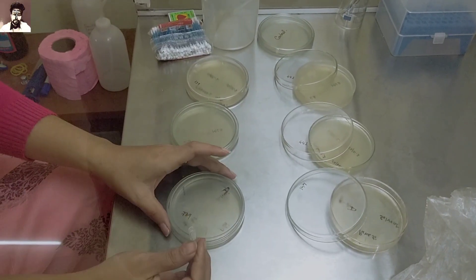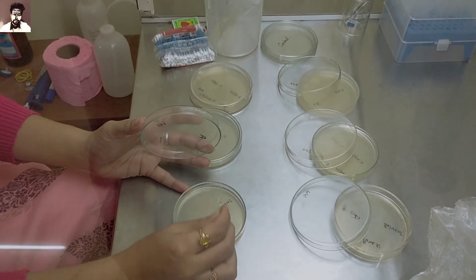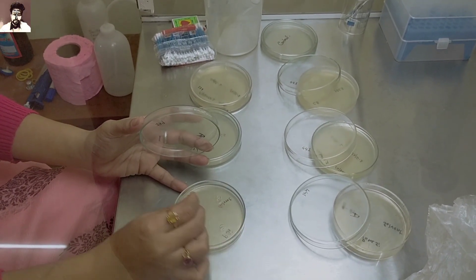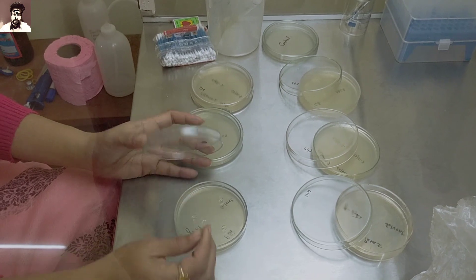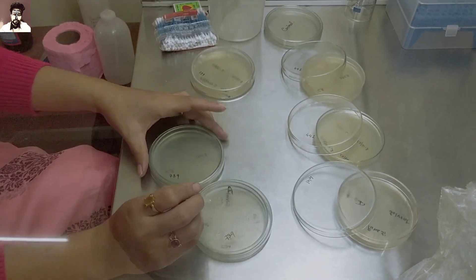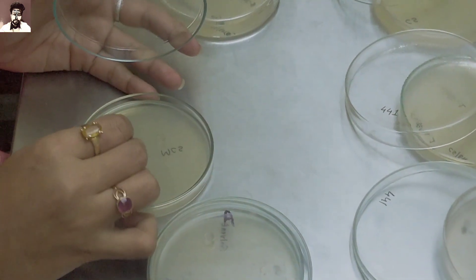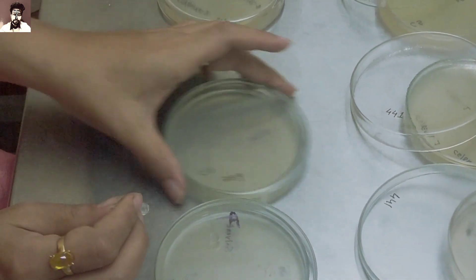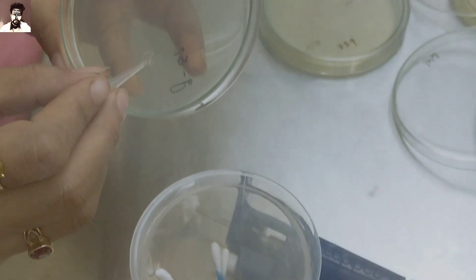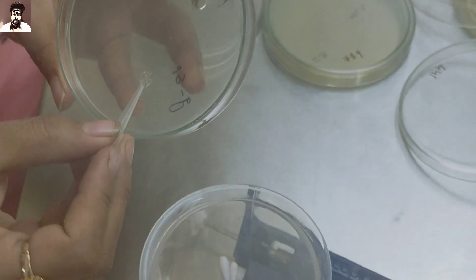This plate will be used as per requirement. In the next step, we place the rubber discs. The first disc is pure rubber, the second is modified rubber, and the third is the solvent.